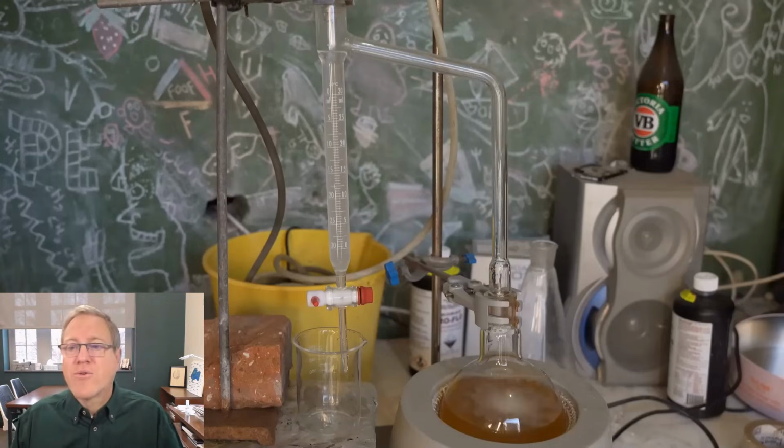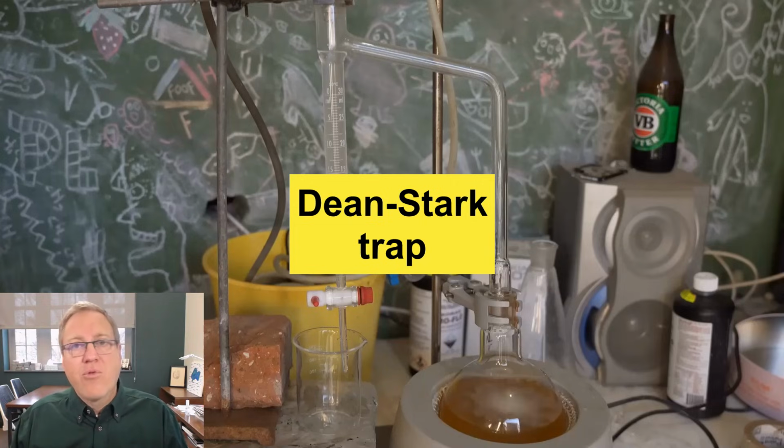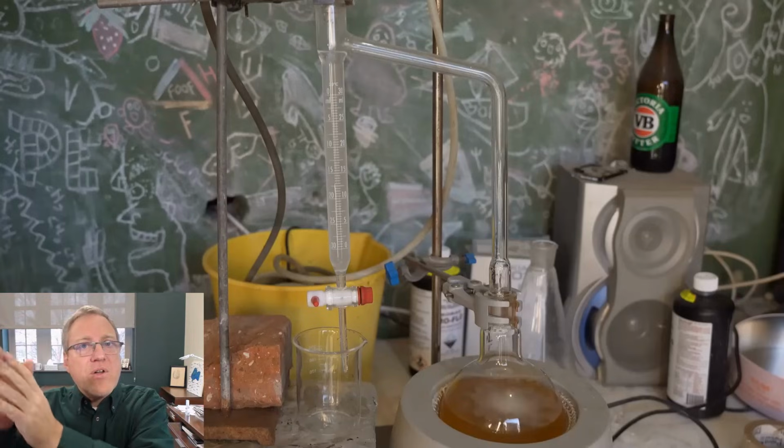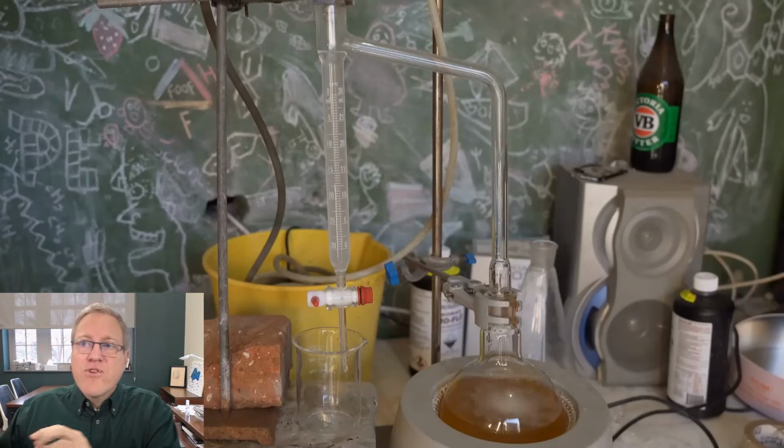How do we remove the water? Well, that's where this image on the screen is important. This is called a Dean-Stark trap. To the bottom right, we have a reaction flask. We heat up the reaction, heat it to boiling. The toluene boils and the vapors rise, and as we form water, the toluene and water will actually boil together and form something called an azeotrope. It rises up the glassware and then travels over that arm to the left, hits that cold condenser, and at that point we now have liquid toluene and liquid water.